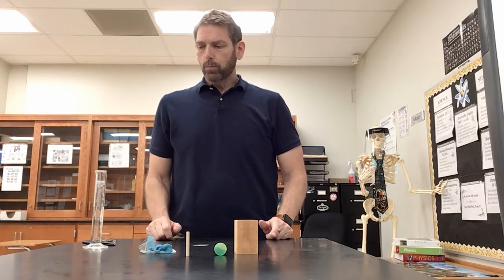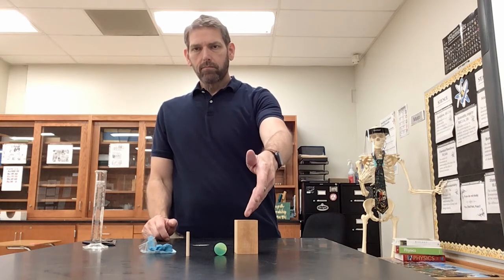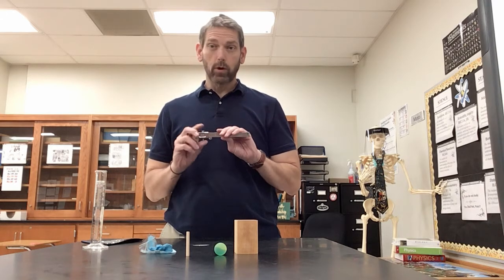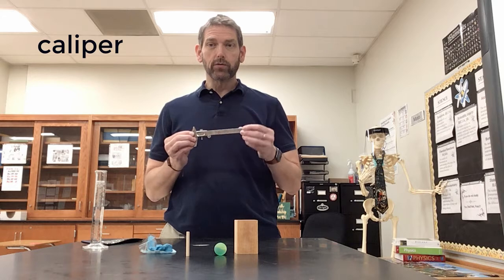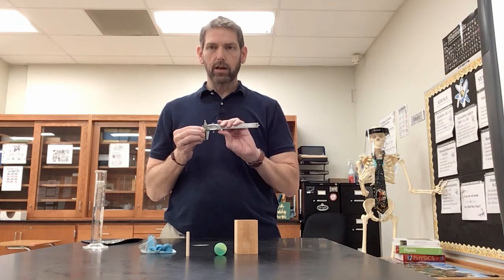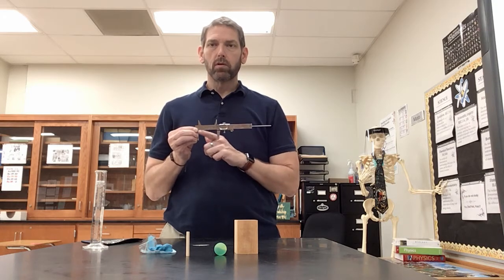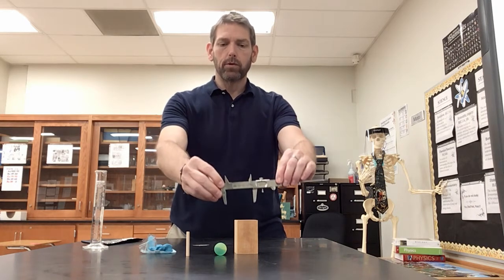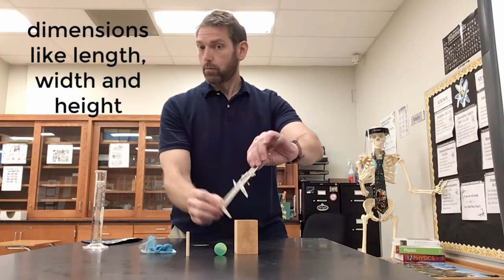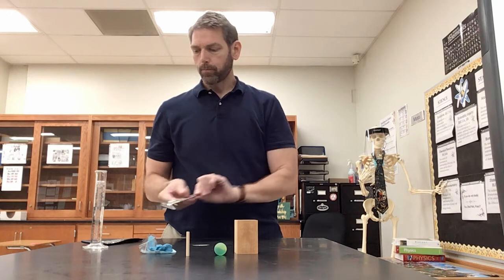Okay, so a couple ways to do this. Early on, if you take something that's geometric, you're going to need some sort of tool that will help you get that geometric dimension. And this right here is a caliper, and it's easy to use. It basically is a ruler that has a little sliding mechanism on it. And as you move this sliding mechanism, the caliper moves back and forth. And you can see that could be useful because you could use it to measure dimensions, right? Highly important tool. And of course, you'll be using these.